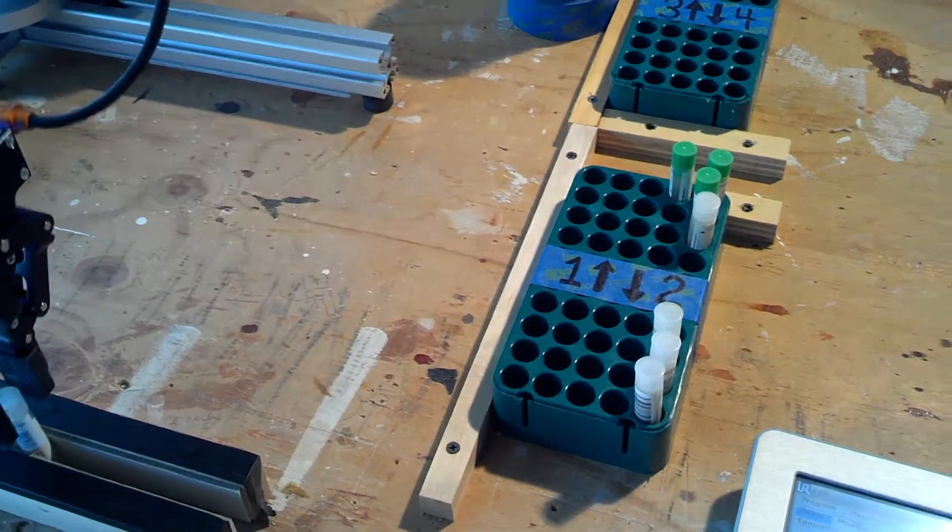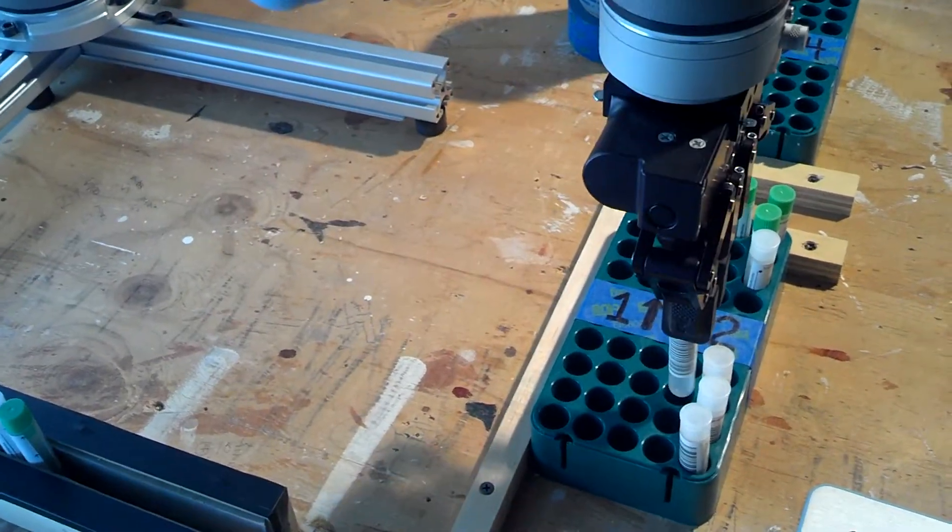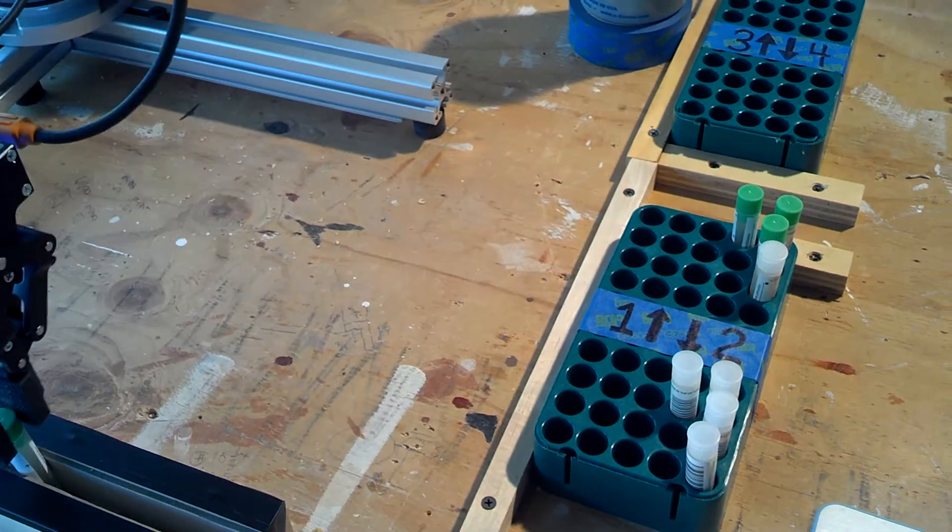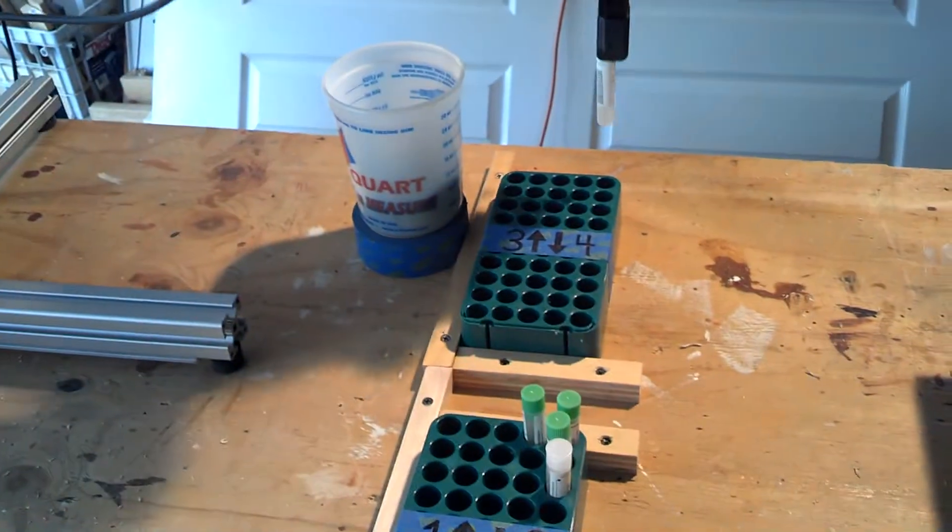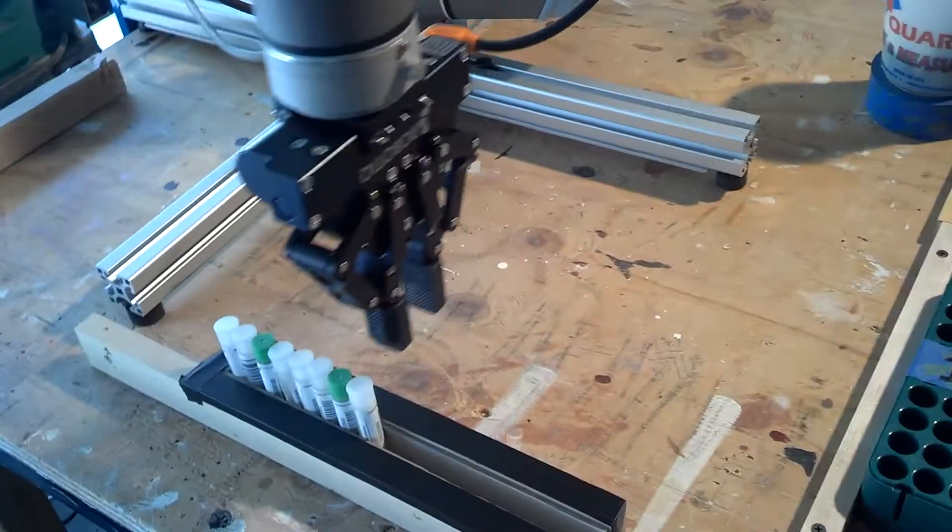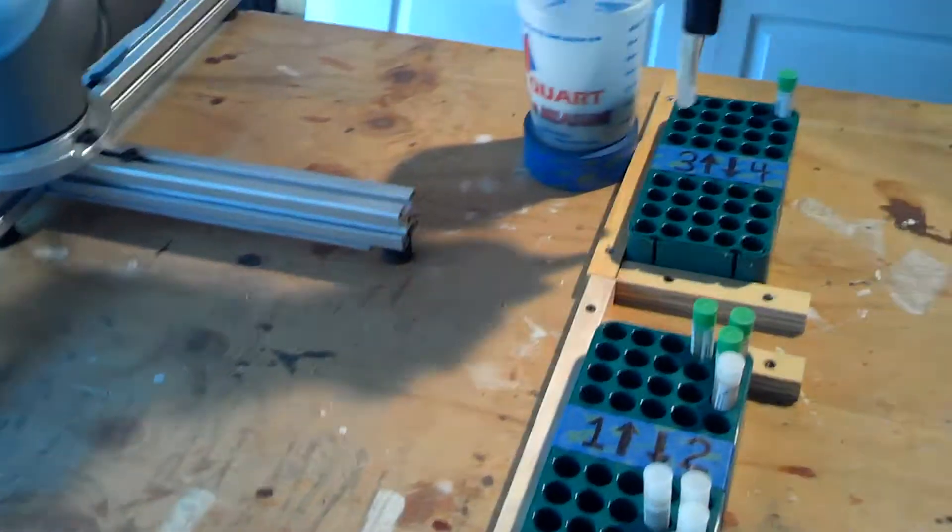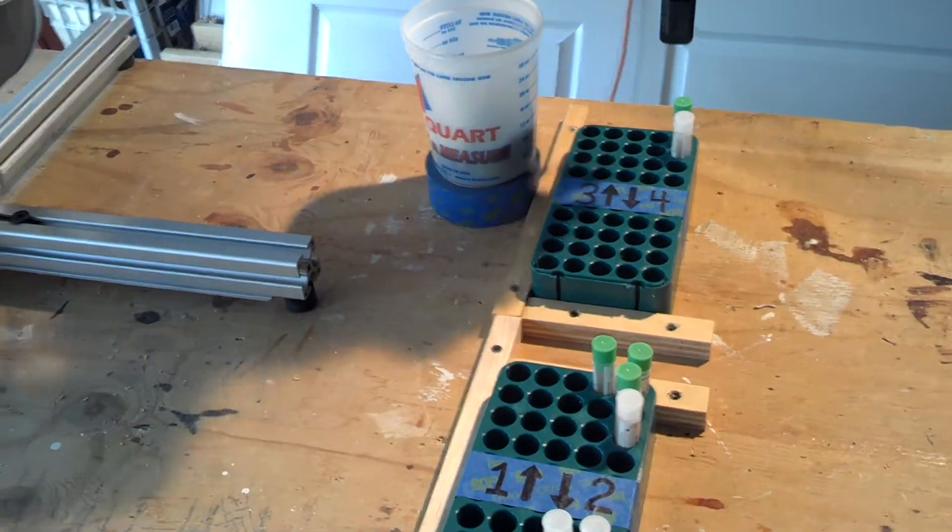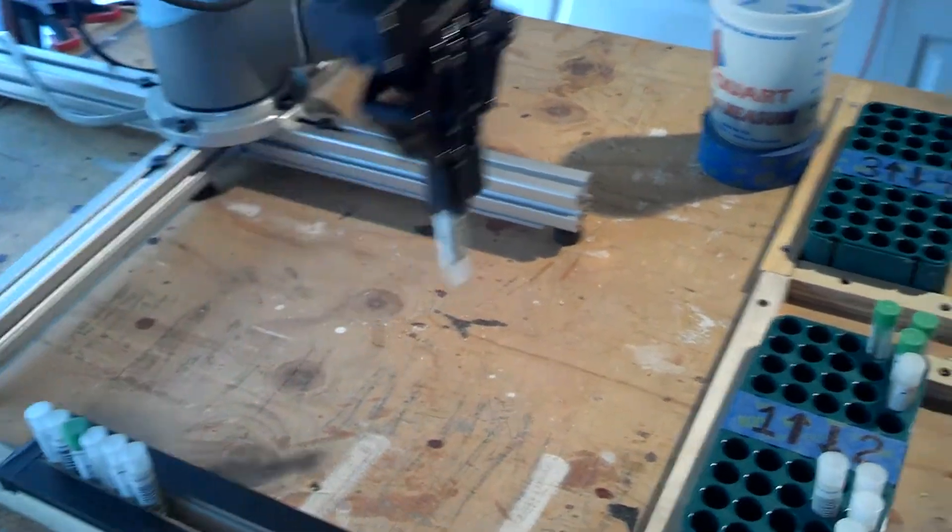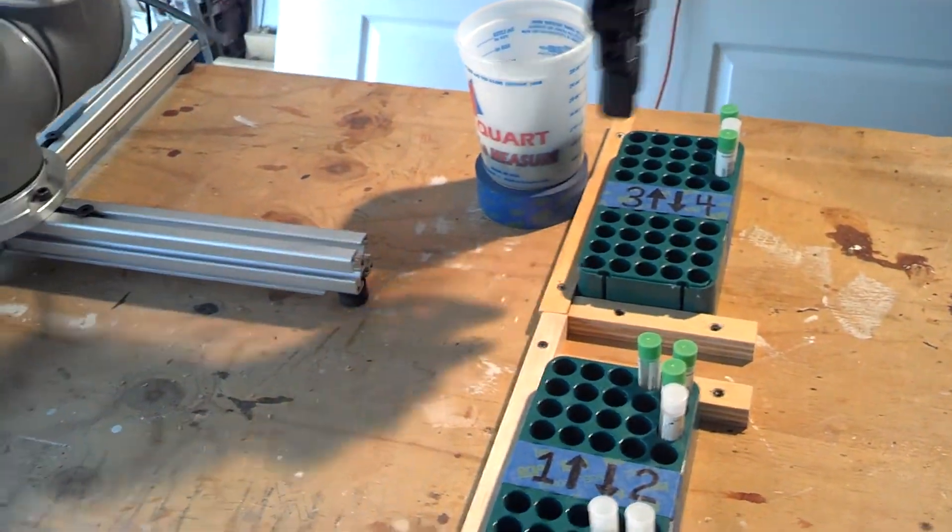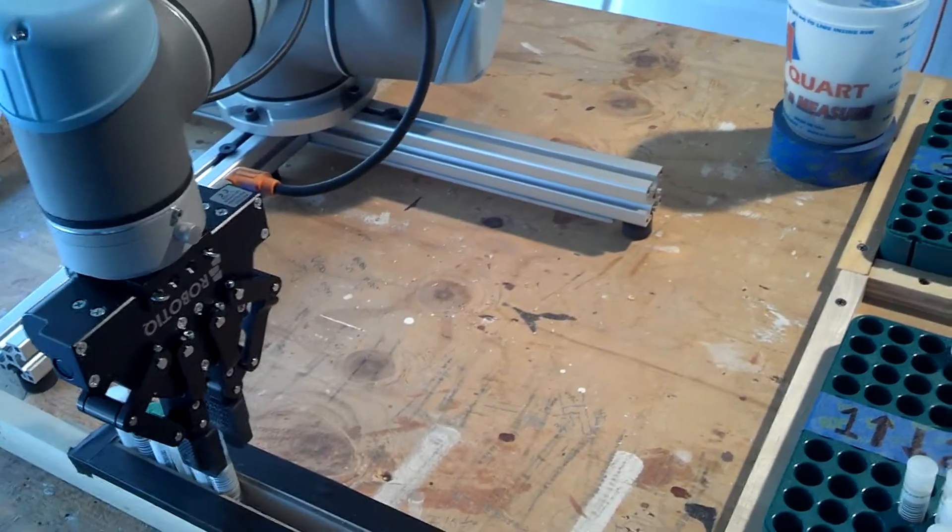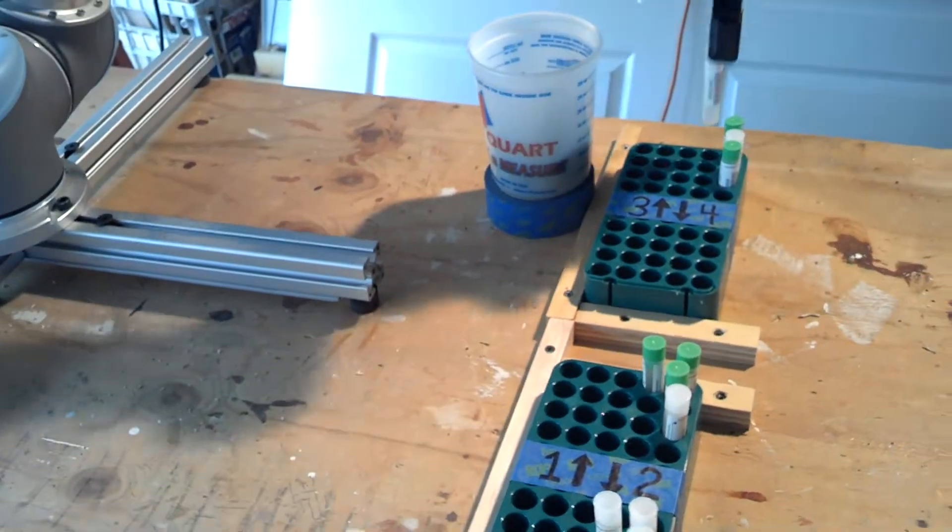So I selected pallet two there, obviously. After this one, I'll select pallet three. So by selecting it through the interface here, I'm simulating a barcode reader reading the label and determining that it's a URN5 or an SRM4 or whatever your part numbering system is.